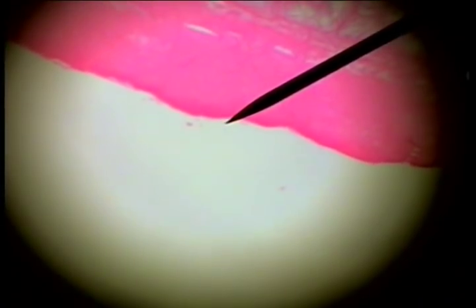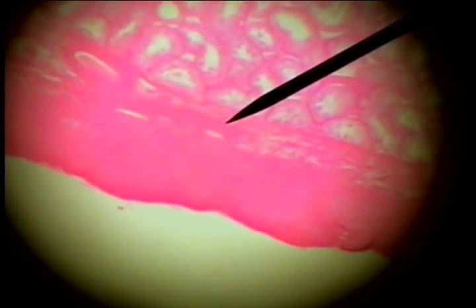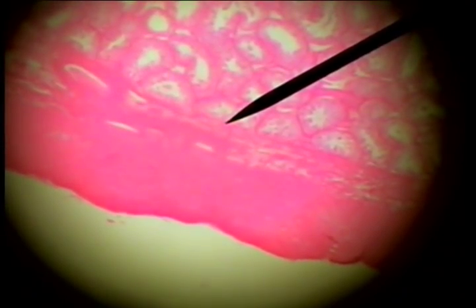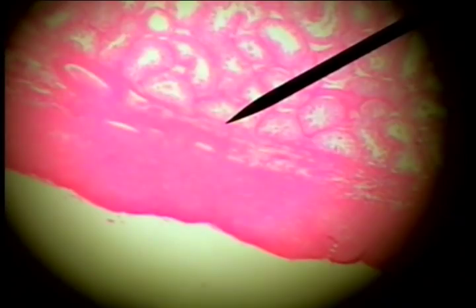This organ is the testis, associated with the reproductive system of the male. It's characterized by a very thick, dense connective tissue capsule called tunica albuginea, or the thick white coat.